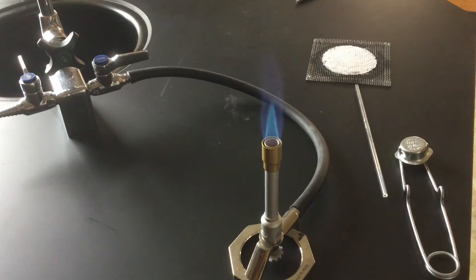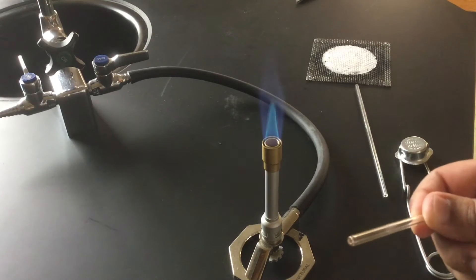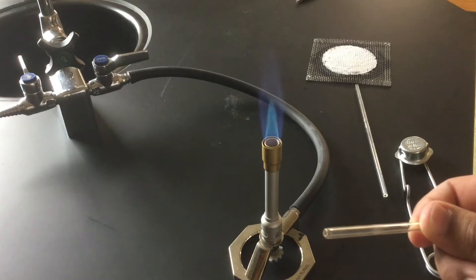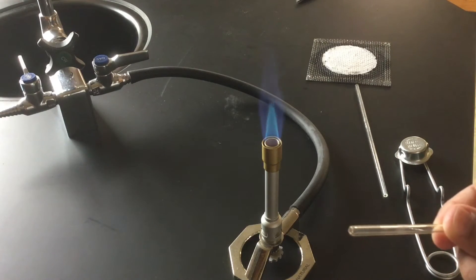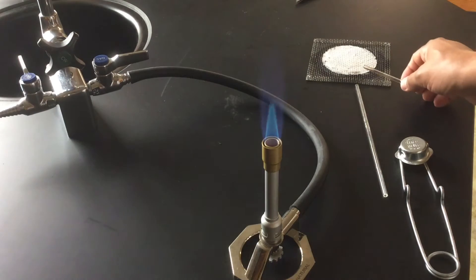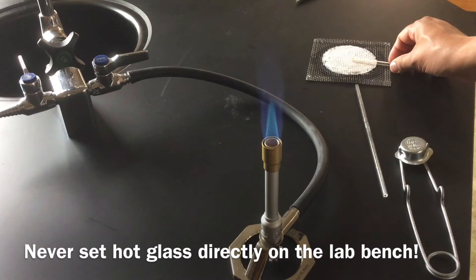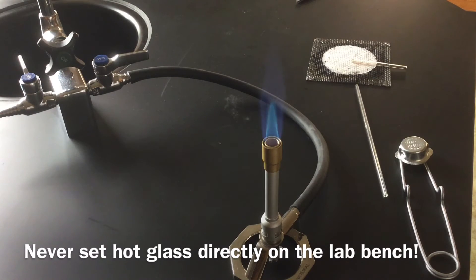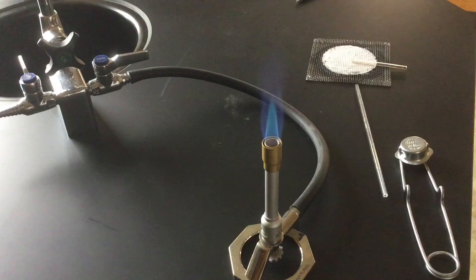Now of course, you don't want to touch that. Don't ever touch hot glass. It takes several minutes for hot glass to cool. So what I'm going to do is I'm going to set this down on the wire gauze over here and allow it to cool. And then about 10 minutes later, I can pick up the other end and fire polish the other end of this.